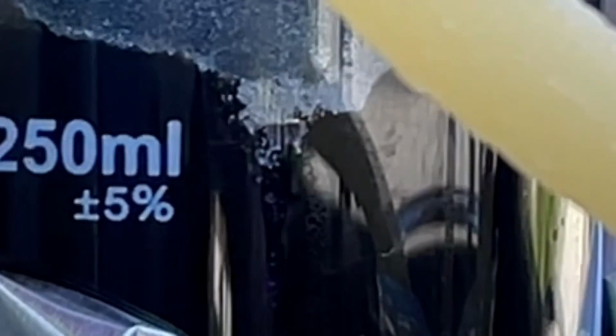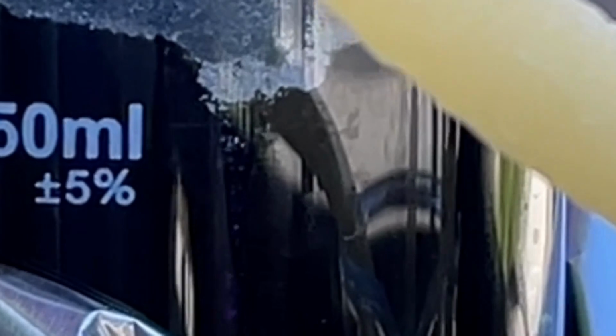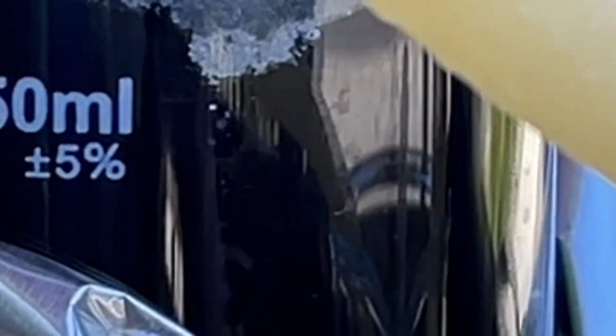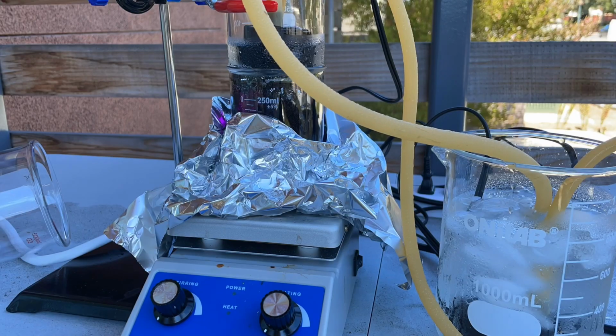After a while, I noticed there were what seemed to be droplets of liquid iodine condensing on the sides of the beaker. It looks like iodine can become a liquid if the temperature gets above 114 degrees Celsius. This means the heat was probably a bit too strong. I think this looks pretty cool though.